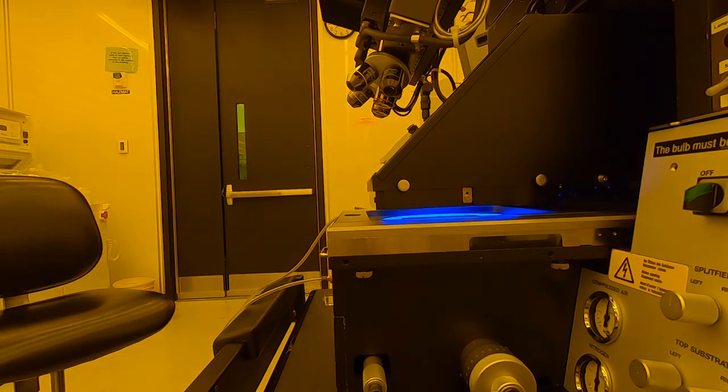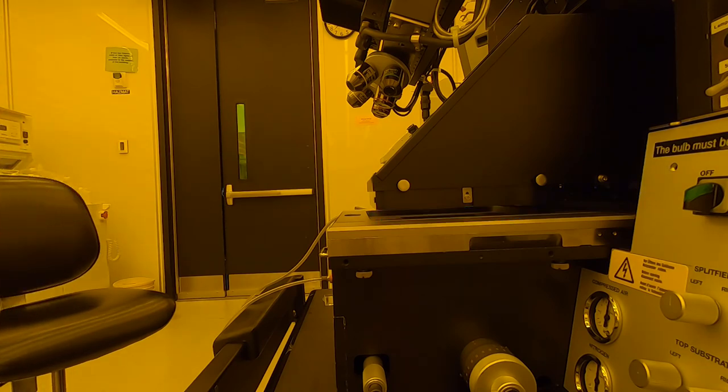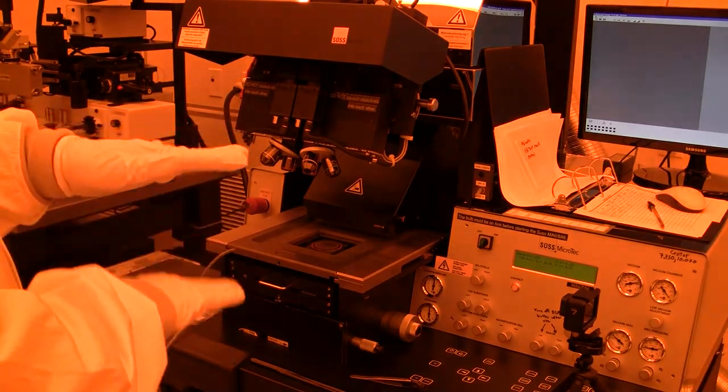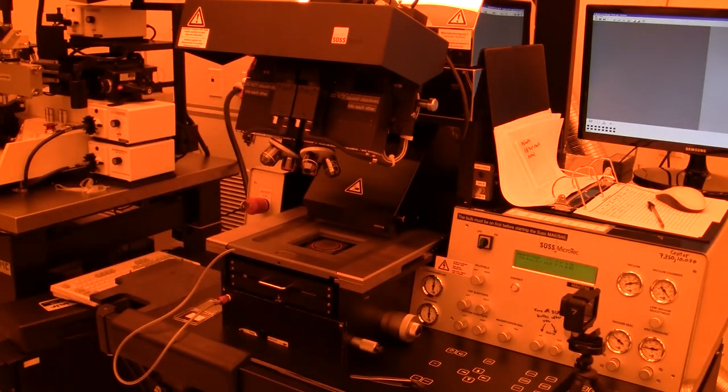Here's our exposure, ultraviolet light. Current lamp power is 420 watts. Lamp housing moves back and it lowers the wafer. I forgot to mention - it puts the wafer in contact with the mask. This is contact exposure.